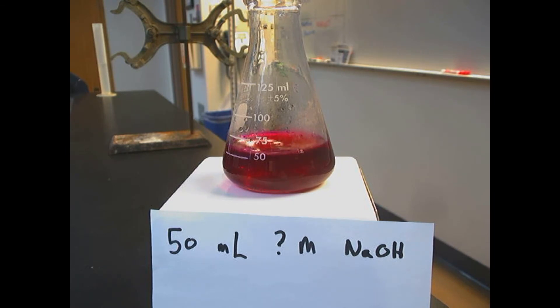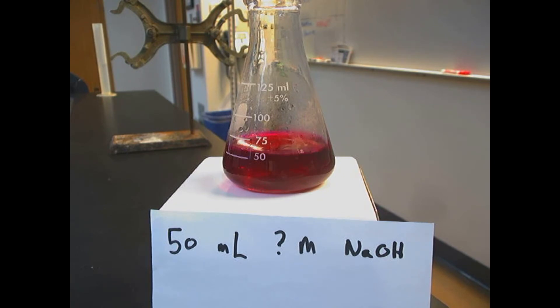So let's get to it. We're going to add our acid to our base, and pay attention until the color changes back to clear. So here is our setup.